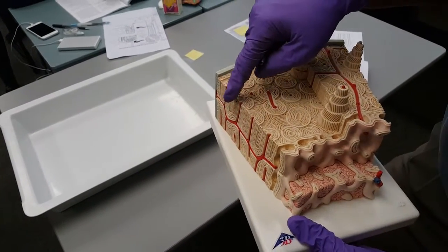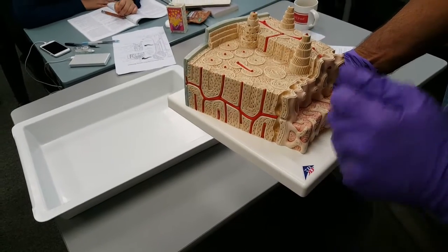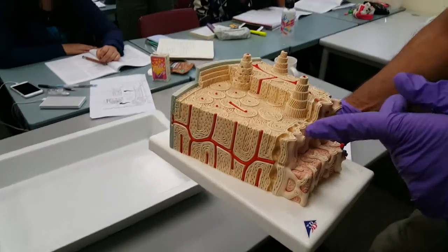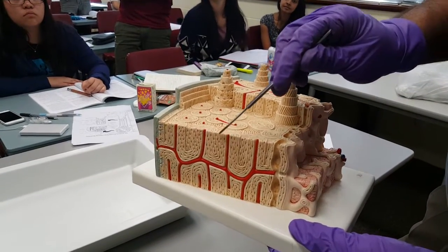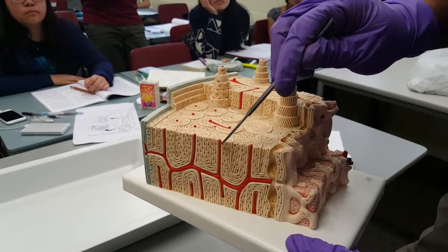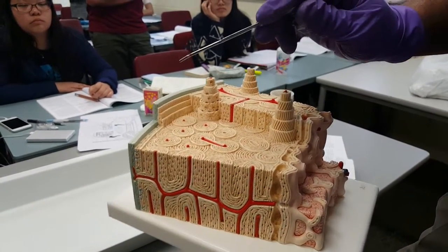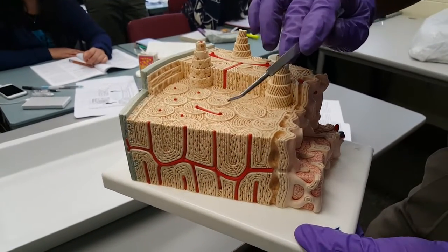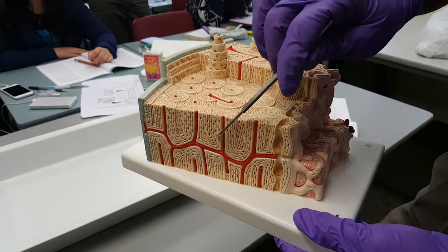Now, this is looking at the osteons that have been cut in transverse section, and if we have a look on the side here, we see what the osteons look like from the side view. You can see them arranged as parallel layers, with the artery running up here in the central canal. So it's good to know what the osteons look like in cross-sectional view and also in longitudinal view.